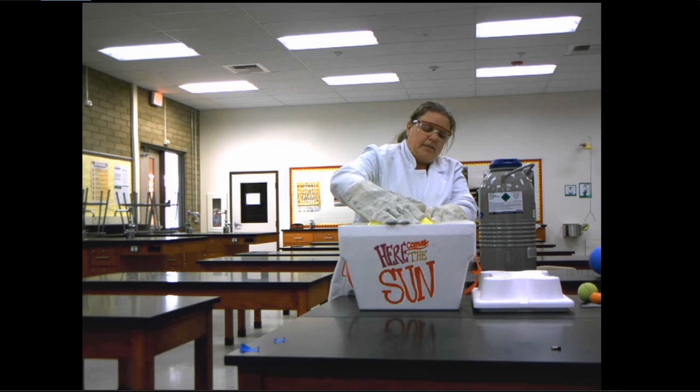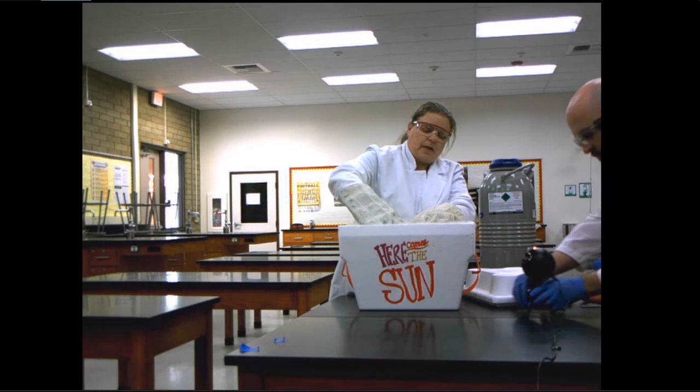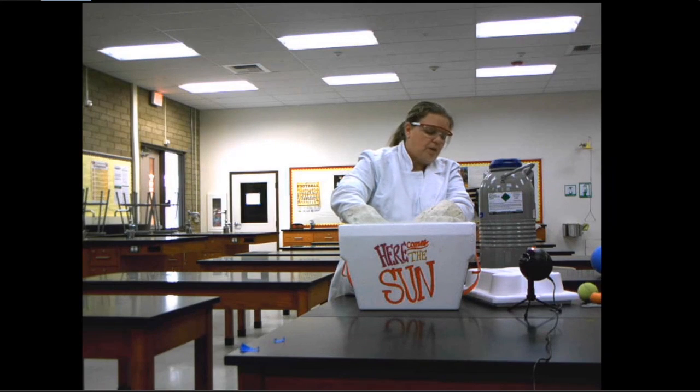About the gases inside this balloon. And if you can see, my hand is starting to go down, okay? And it's starting to shrink, okay? So think about, what am I changing when I put in the liquid nitrogen? When I change that, it's either pressure, volume, or temperature. What else does it change based on those gas laws?